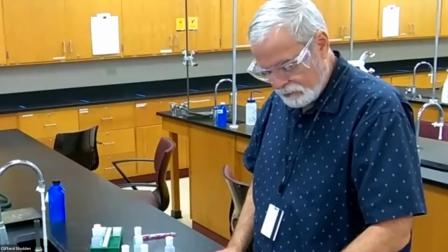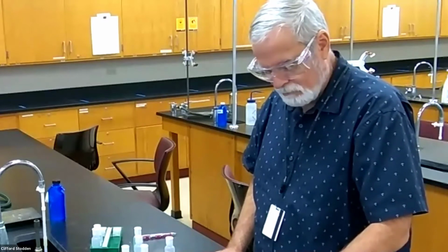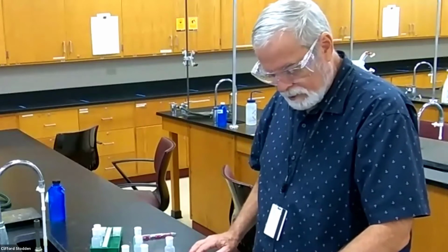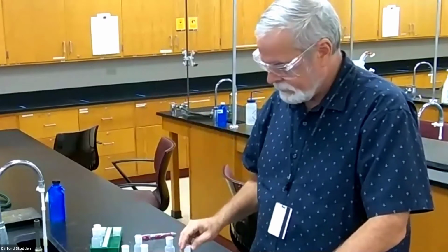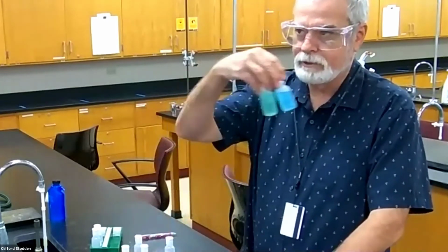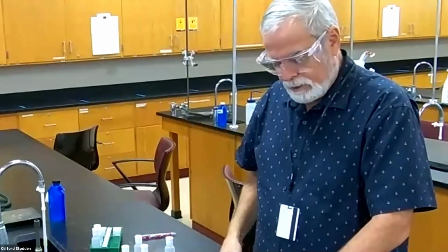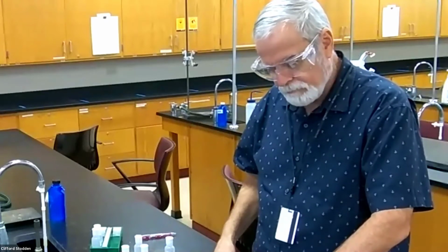The aluminum nitrate and copper, I'm going to skip that one because there's not really anything that I would expect to happen from that. Nickel nitrate, that's the green one. That's not going to tell me anything if I add those together, because I know I have the identity of both the copper and the nickel anyway. So I really only want to record things that might give me more information. So you can put a no reaction for the nickel.